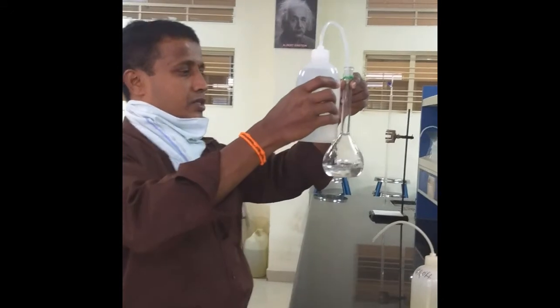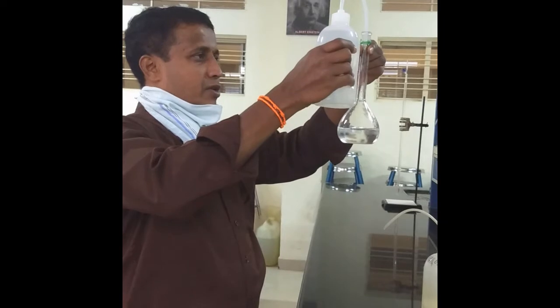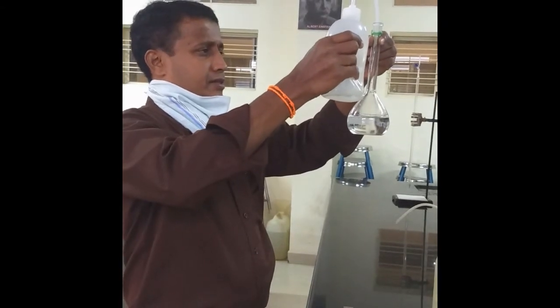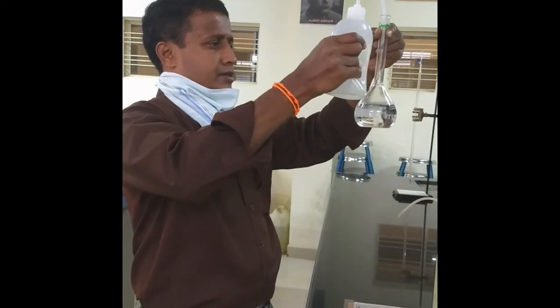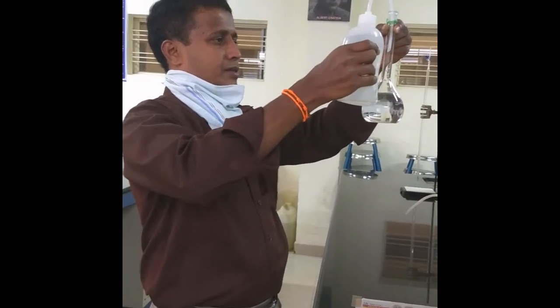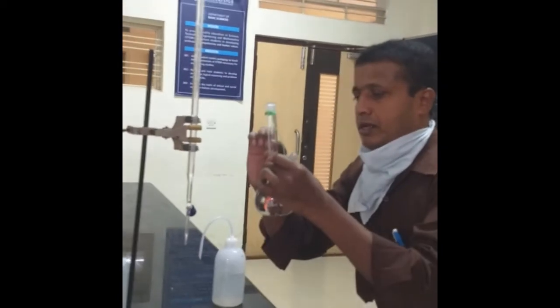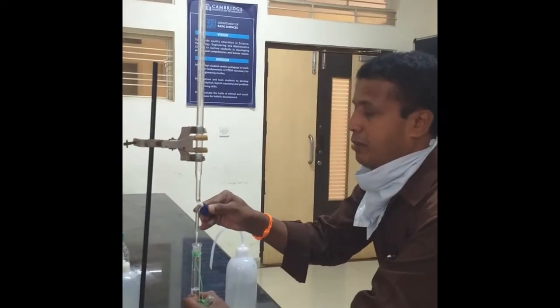You can fill this distilled water using this wash bottle up to the stem and a little portion below the mark. The remaining portion, just below this mark, needs to be made up with the help of a burette.